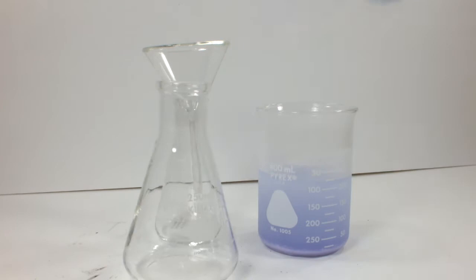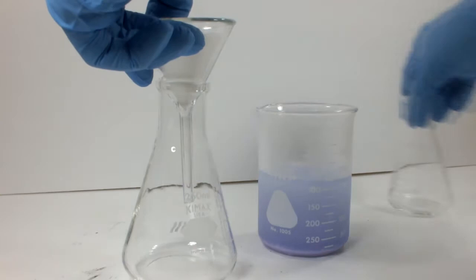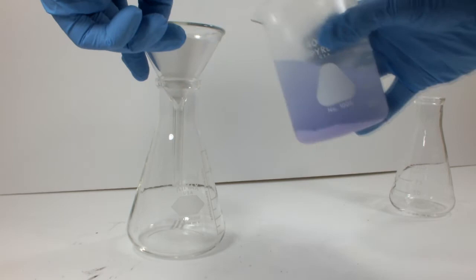The liquid phase is still strongly colored, so this complex is definitely more soluble in the acetone-water solvent than the sulfate complex. It's time to filter it and see what we get.